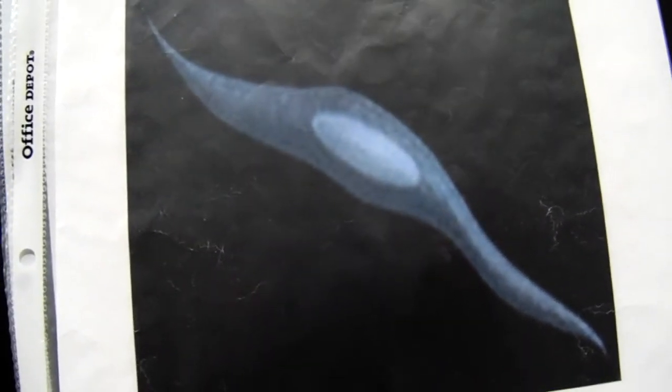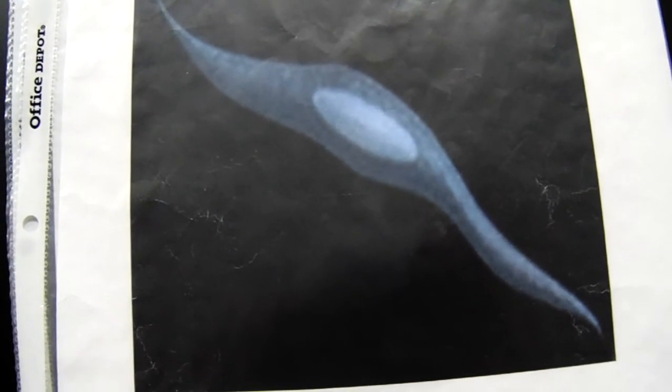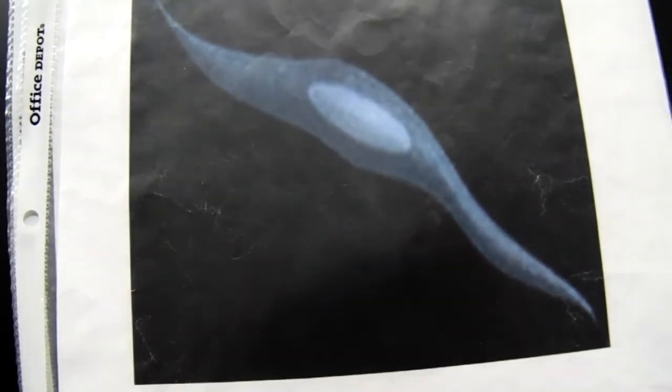Here's smooth muscle, just one smooth muscle cell, what it looks like under a microscope. There's thousands of these that make up a smooth muscle. They're hormonally controlled. See, one nucleus, they're fat in the middle and tapered on the end. So all the sphincters in the body, your iris in your eye, the uterus. So this smooth muscle is all over the body. It contracts the GI tract, the gastrointestinal tract, this whole line with it. So it contracts and moves the food down your GI tract. Okay, smooth muscle.